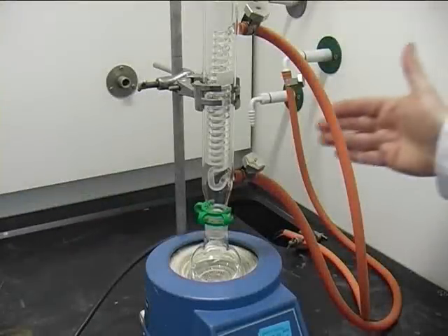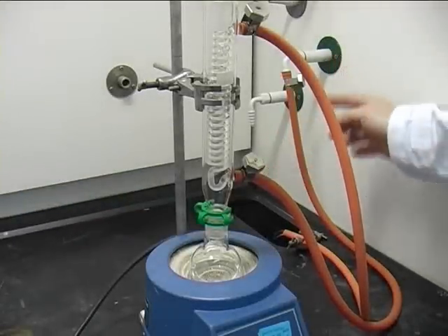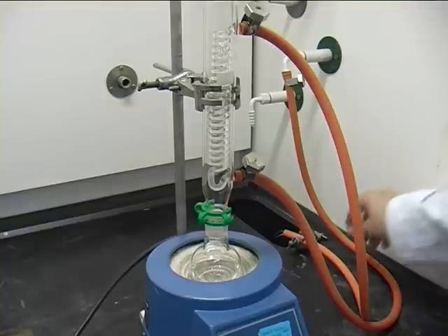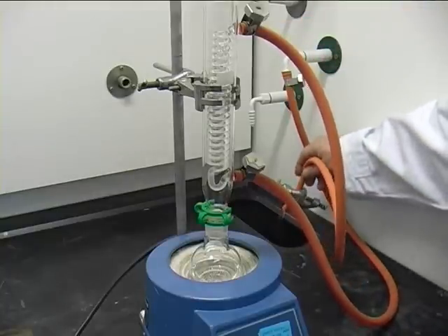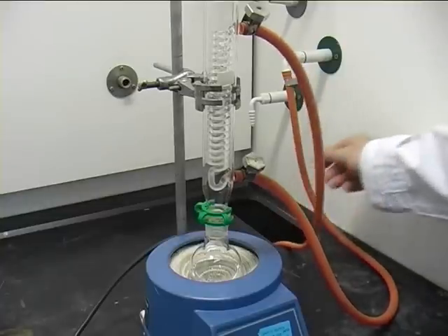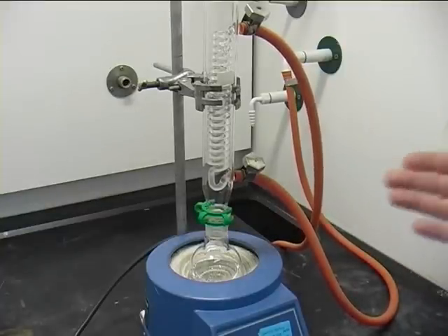Here you can see the setup in the fume cupboard. I'll point out where the water comes in from the green tap and where the water comes out. Please have a look at the water flow—that's not too high—and that the tubing is weighed down with a boss which helps to make sure it stays in the sink.